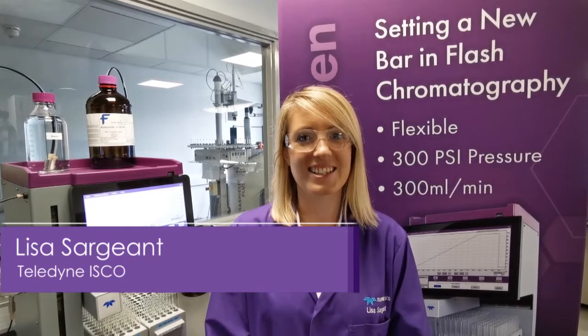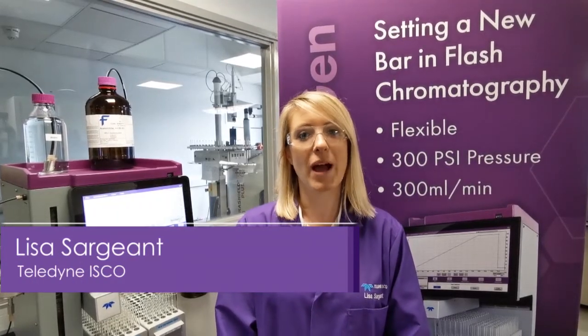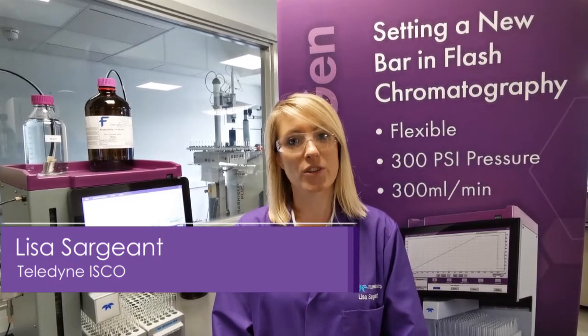Hi, I'm Lisa from Teledyne ISCO and today I'm going to show you how you can make the most of having the four solvent lines on our next-gen 300 plus in order to run simultaneous gradients. So let's have a look.